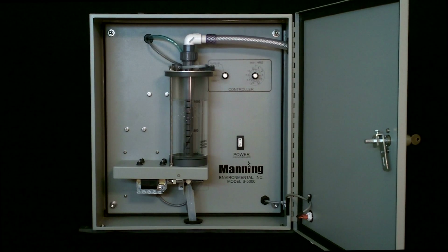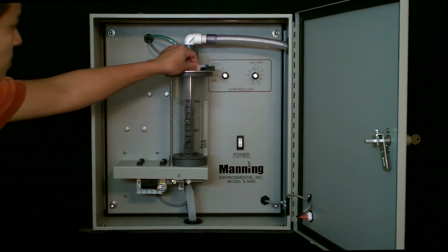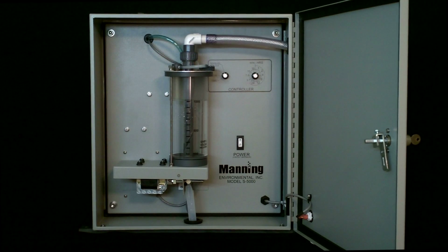There is a high side and low side on the switch. When the unit has entered the draw phase, squeeze the high side tube and roll your fingers towards the pressure switch. This should trigger the switch and cause the unit to switch to measure. It does not test how sensitive the switch is. Whenever you use a new setup, a dry test cycle should be performed, and this test should be successful before wet sampling.